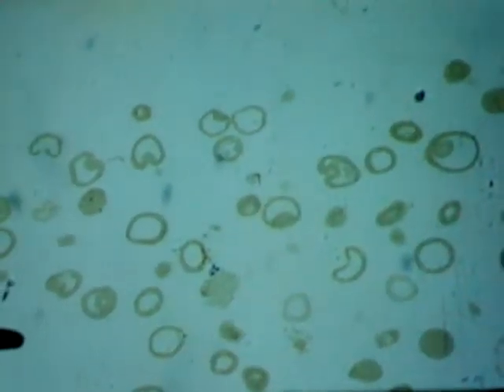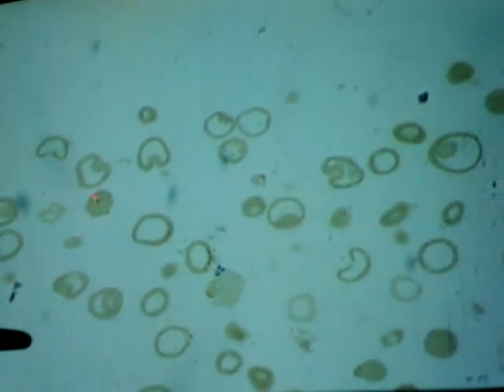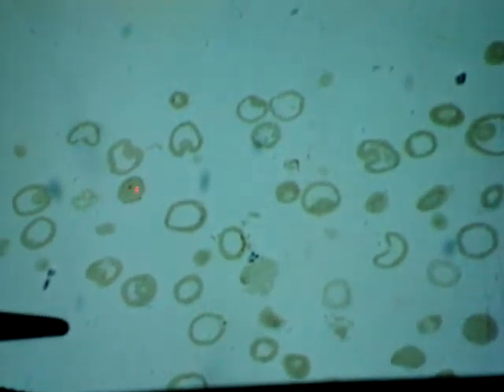So, the gastrula? We haven't gotten there yet. Okay, so this particular slide, we've got an unfertilized egg.